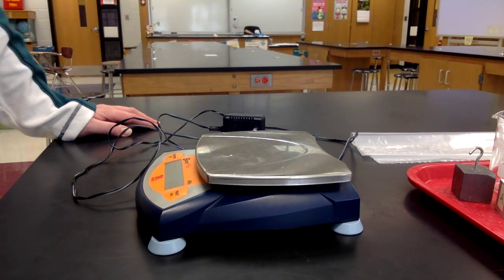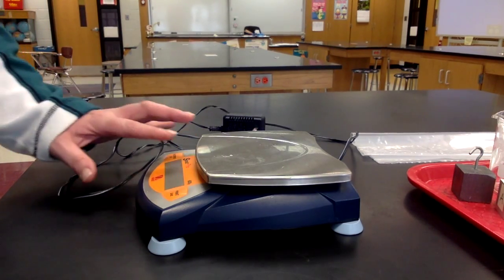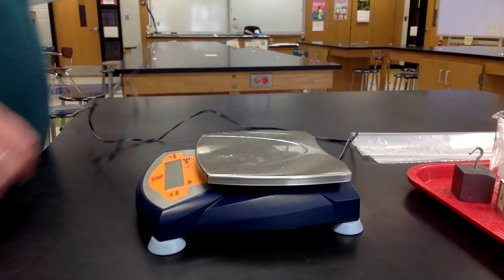This video will help you with measuring mass. First, plug in the electronic scale.